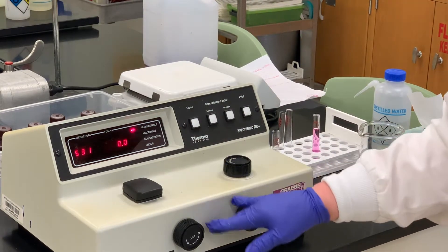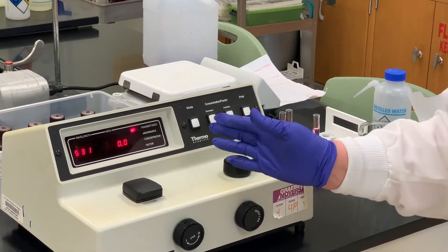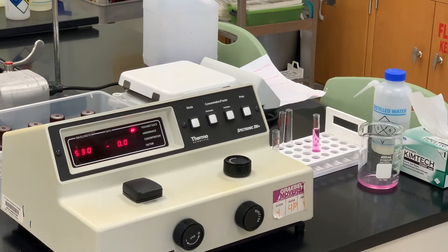Since we've already calibrated the machine with the last measurement at the 530 we're not changing the wavelength so I don't have to go back and recalibrate to that extent that we did before when we changed the wavelength.